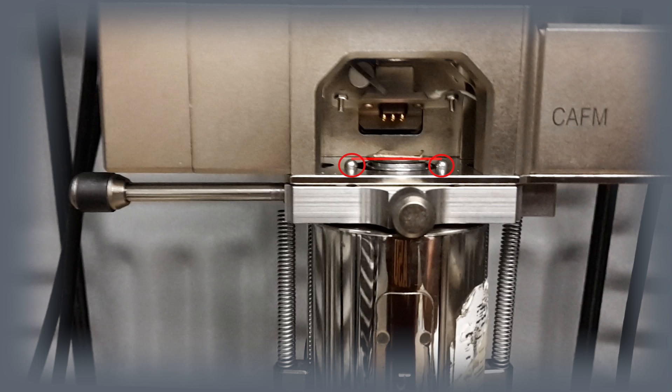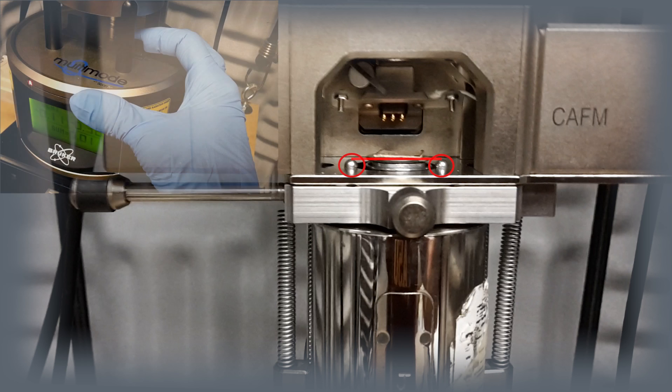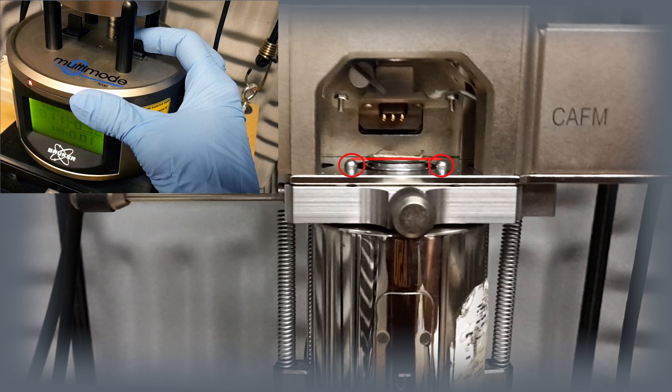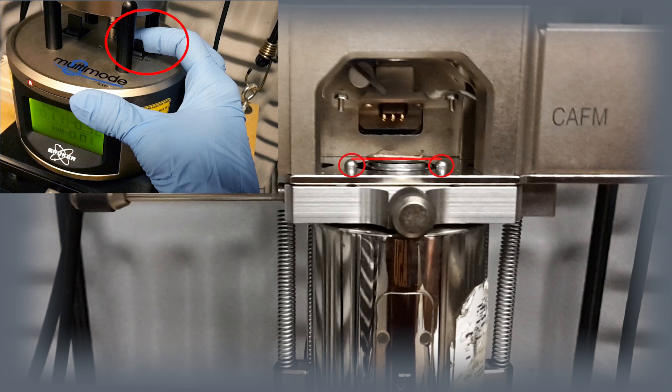If the sample surface is above the height of the pins, click and hold the switch at the base of the microscope in the up position. This raises the optical head to a safe distance from the sample to install the probe safely without possible damage to the tip.